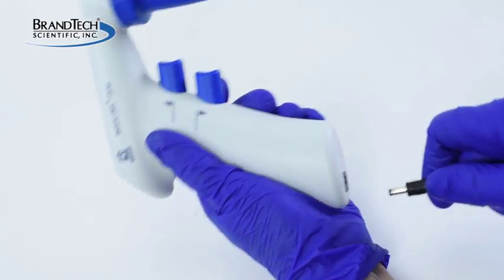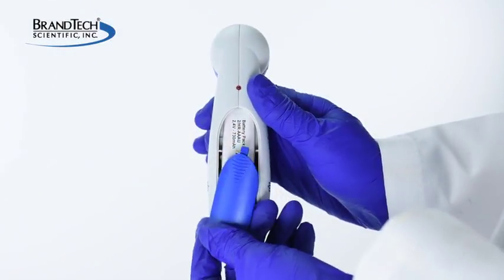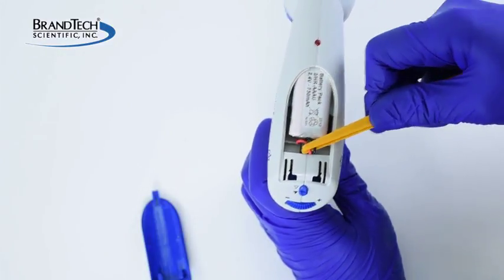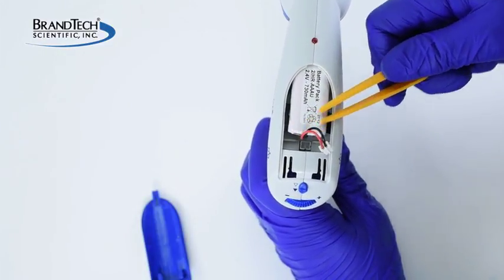First, unplug the charger from the instrument, then remove the battery compartment cover and disconnect the battery. The use of forceps may make it easier to grasp and remove the battery plug.